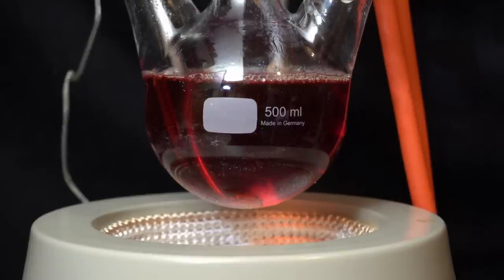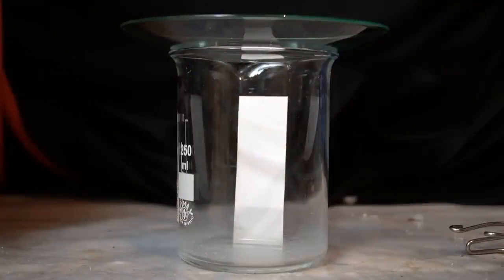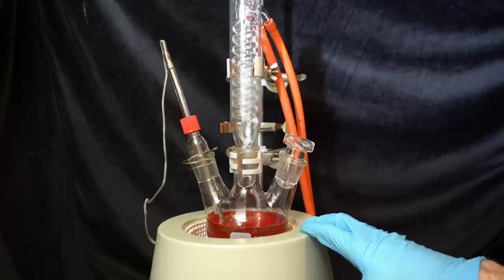I check up on the reaction progress with another TLC and there is still ammonium salt left so I continue heating for another hour.